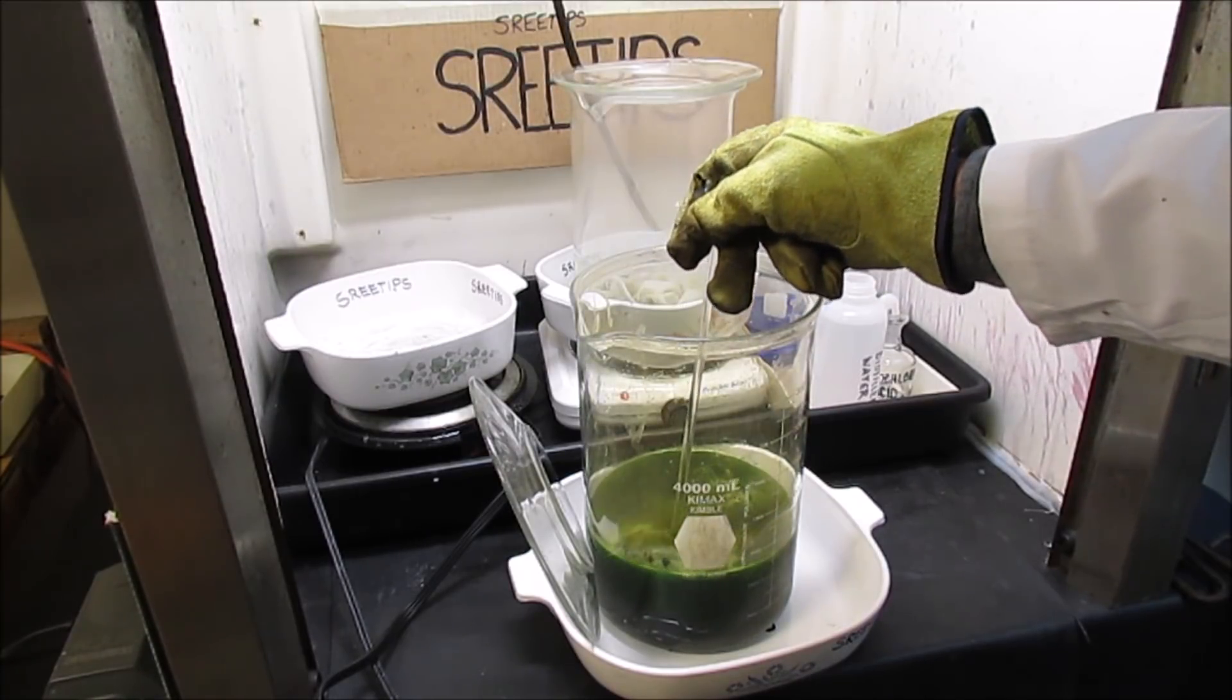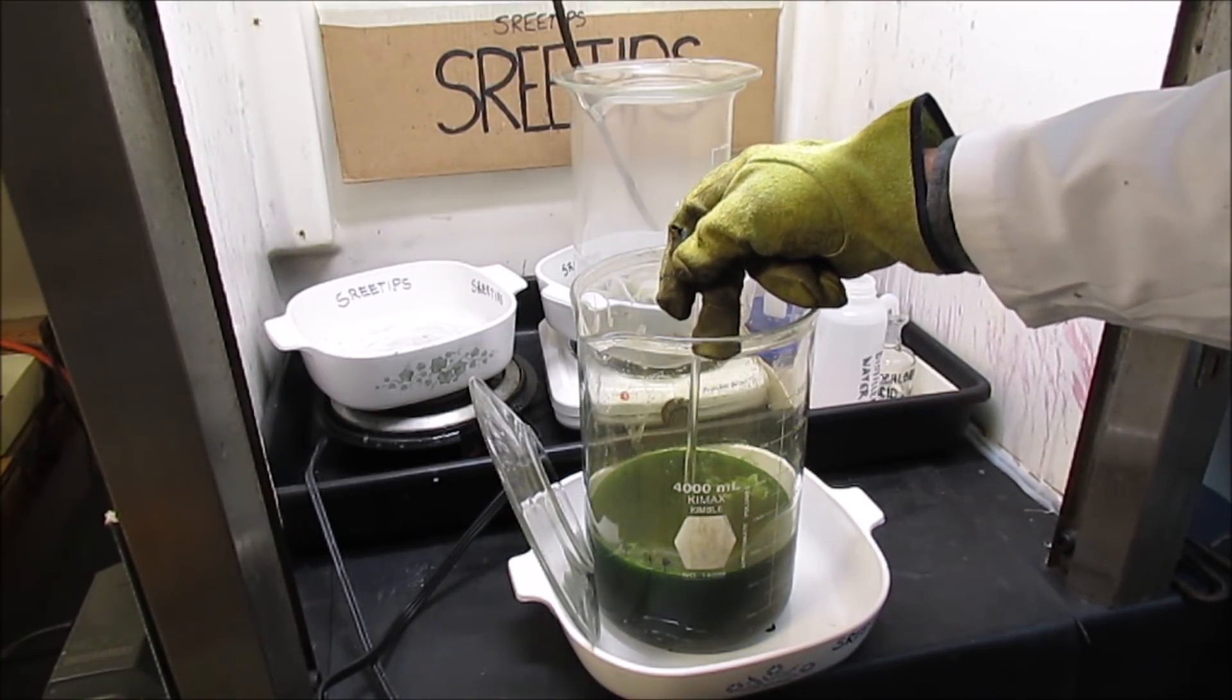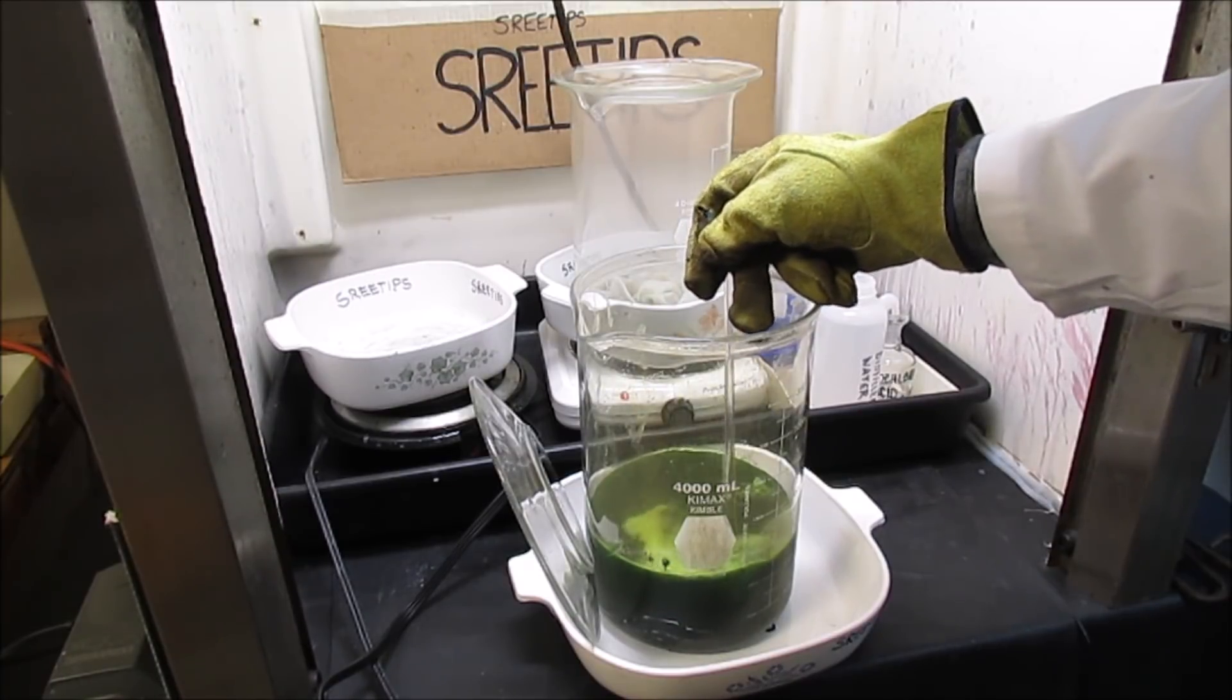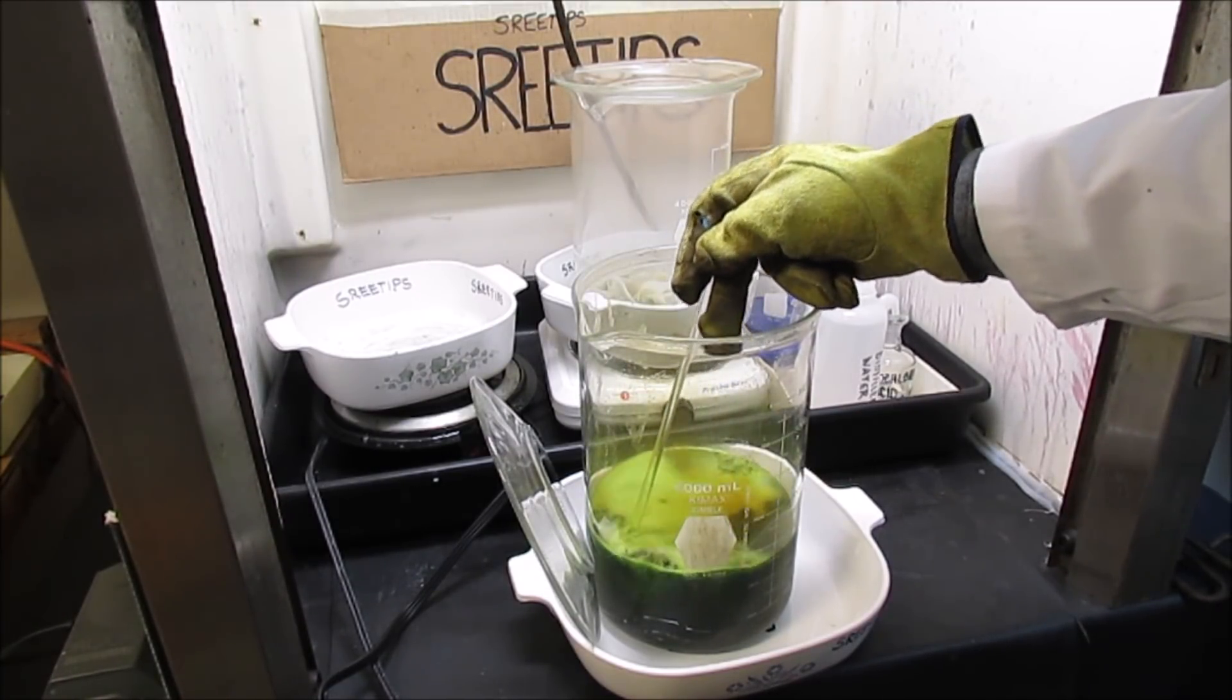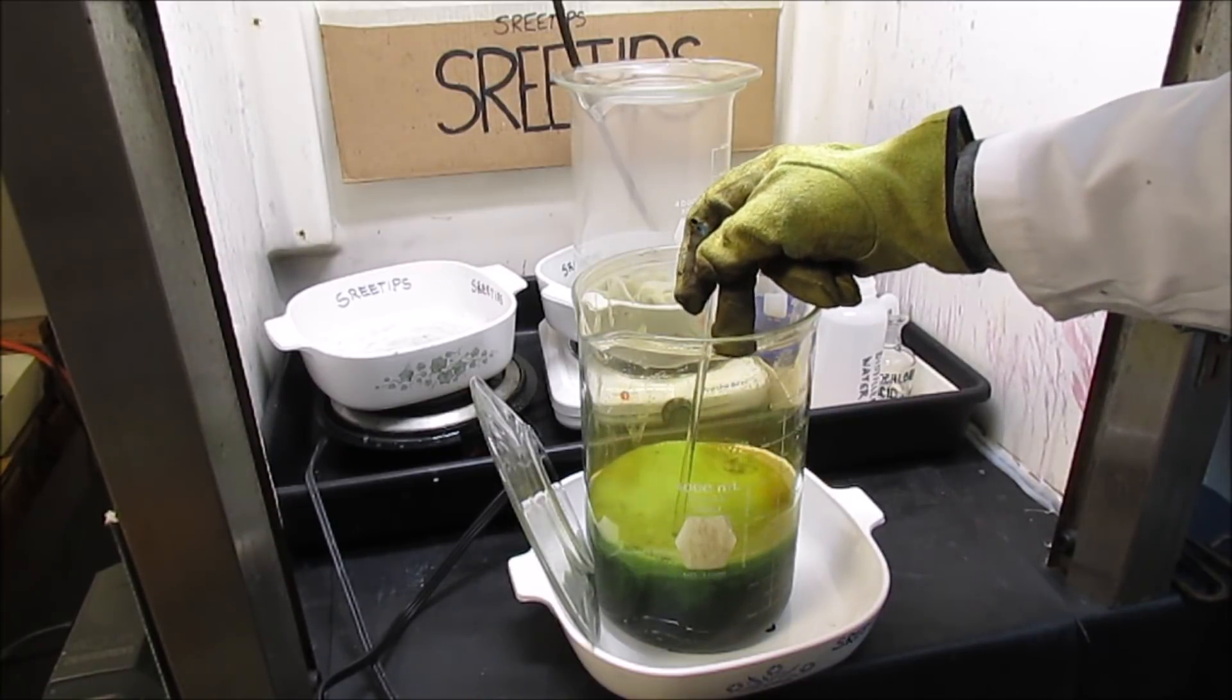Stuff's caked up on the bottom there. When it hits that hot acid as I stir it, it reacts pretty vigorously. So I'm going to have to watch how I add this acid. Don't want to add too much, it'll boil it over.